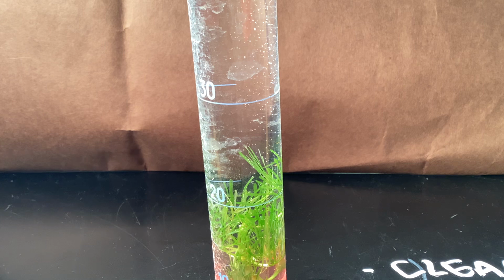All right, minute 7, there you go. So now we're going to finish up collecting 1 more minute's worth of data.